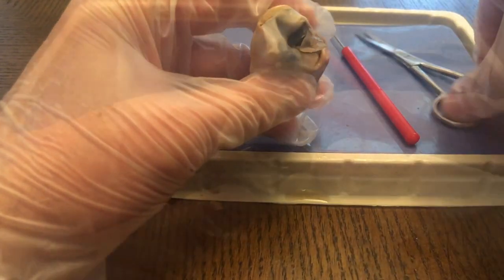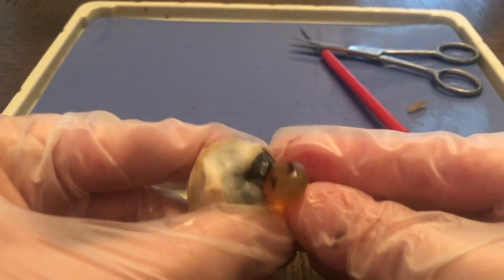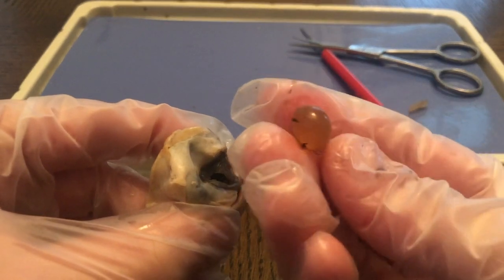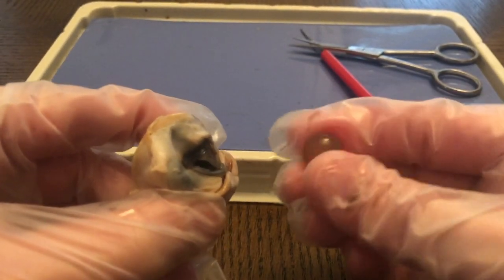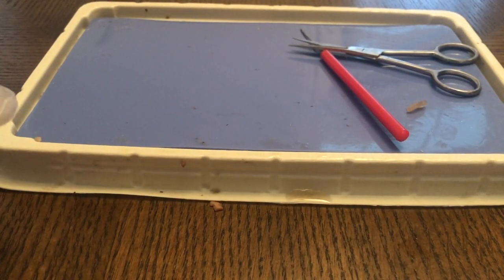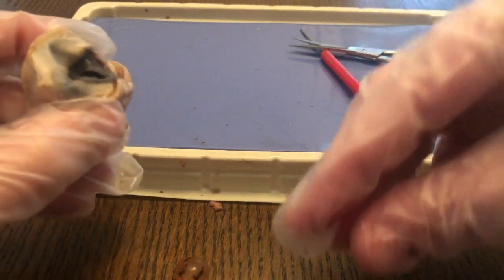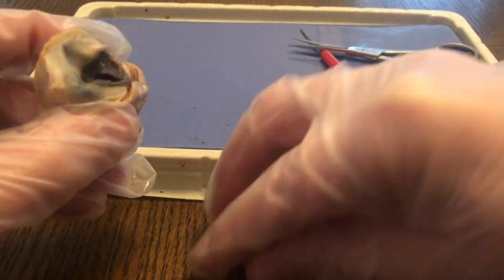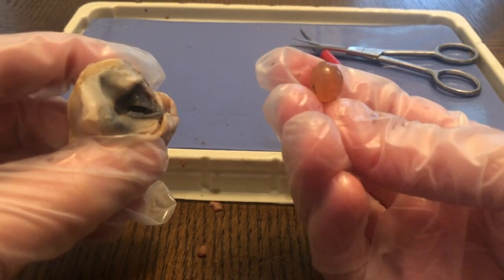So let's remove that. So I removed the cornea, and I'm going to reach in here and I'm going to pull out, oh, there we go. Here we have the lens. You can see the lens. It's a lot larger than the fish and the frog. It is hard. Oh, it just rolled away on me. It is hard and it will bounce. Okay, let's try that again. It's biconvex, meaning it bulges out on the sides.